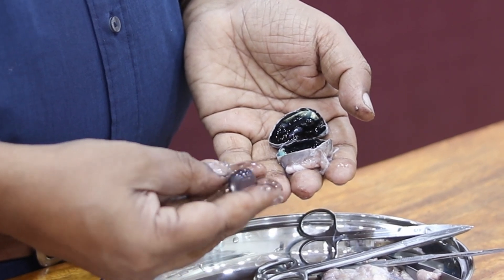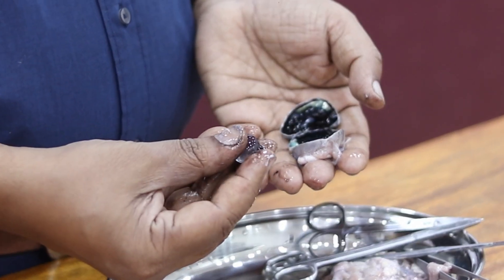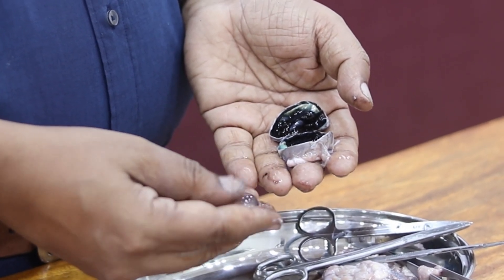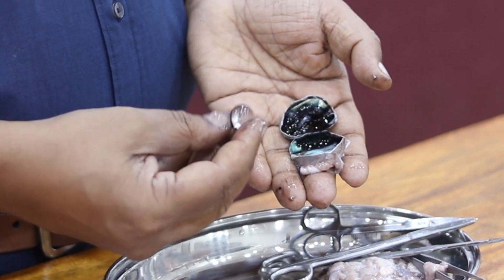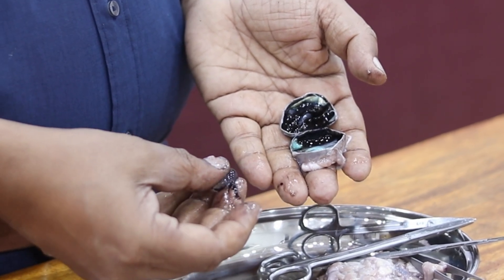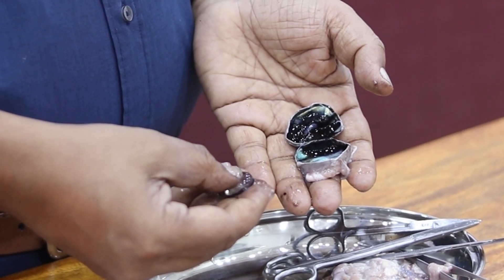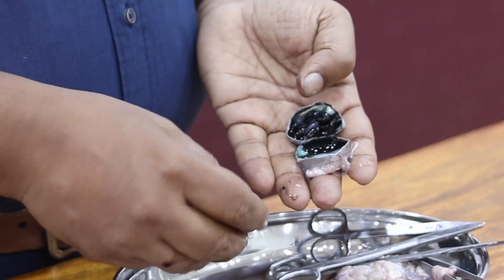Inside the lens, lens fibers are present. This is a soft structure and the curvature of this can be adjusted by adjusting the ciliary body. The lens has a nice rubbery feeling. It's very soft, like a jelly, but it has a cellular structure — keep that in mind.